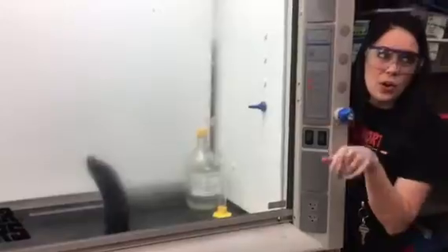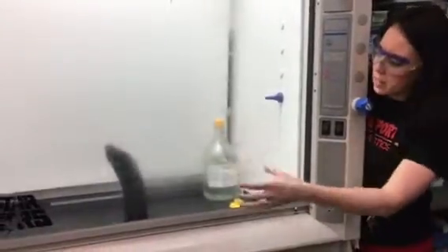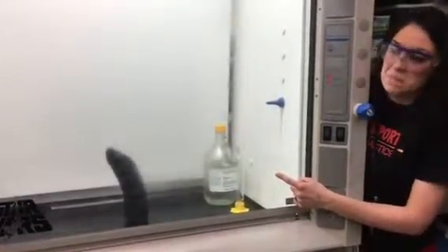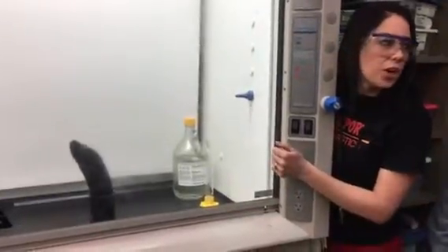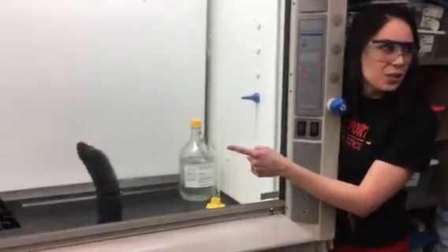Oh, you guys got a good one. This is insane! What's the formula for sugar? C-6-H-12-O-6. What's the ratio of hydrogen to oxygen? Two to one. What do you think that stuff is coming off of it right now? Water. What is water when it gets really hot? Steam. So if the H-2-O's are coming off of the sugar — thanks to the acid dehydrating it — then what's left of the sugar? Carbon. That's pure carbon right there. That's in the sugar that you eat — that's literally what the atoms look like.